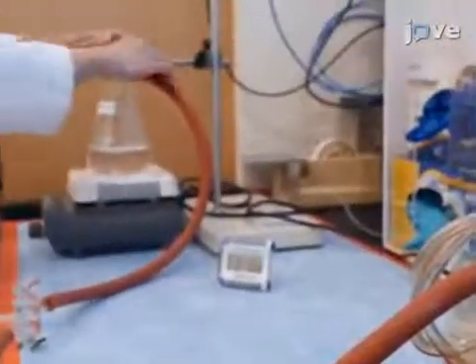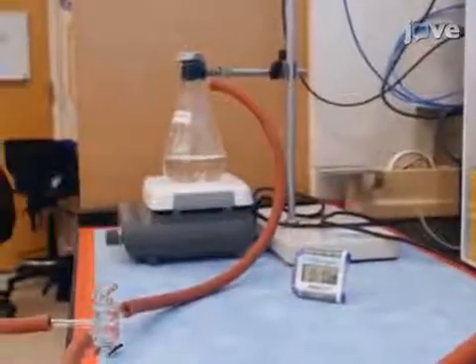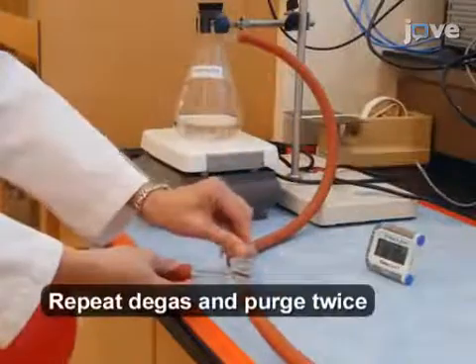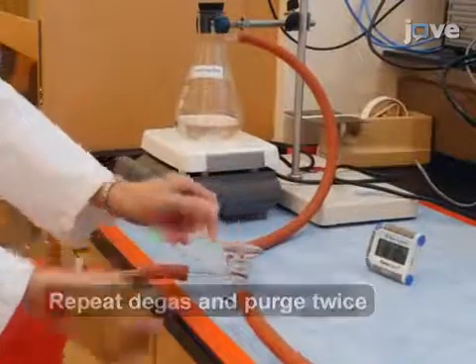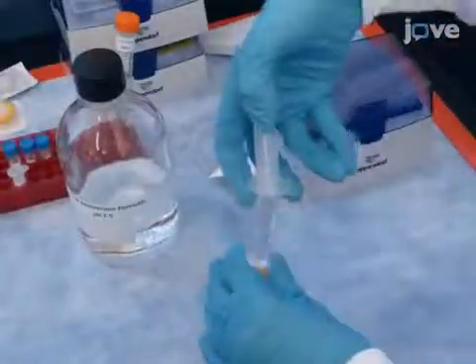Degas a 5 millimolar ammonium formate buffer under a vacuum system for 10 minutes and purge with argon. Repeat twice and store the solution under argon. On the day of use, filter the buffer solution through a 0.2 micron filter before use.